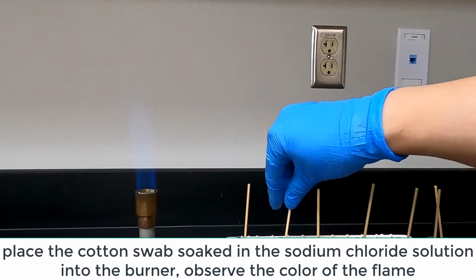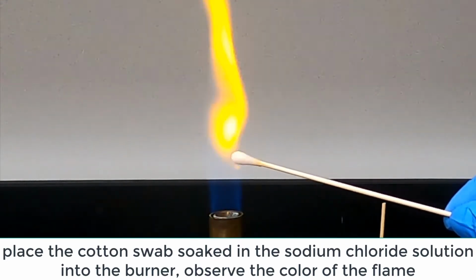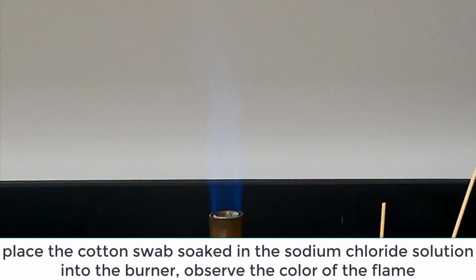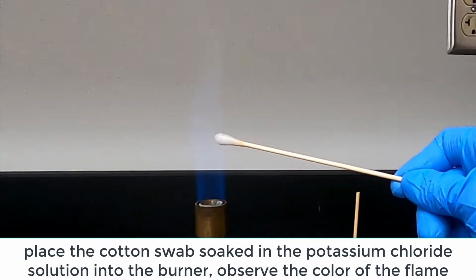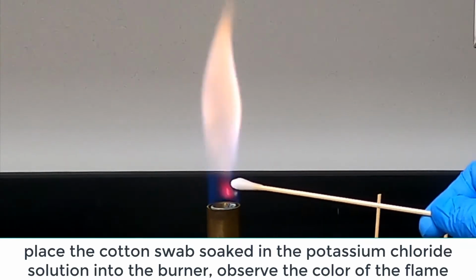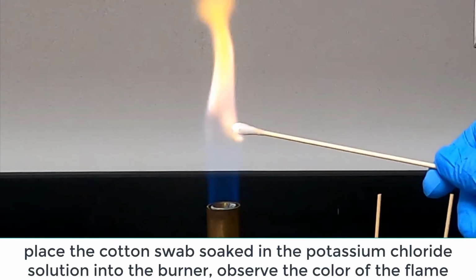Repeat the flame tests for sodium chloride, record your observations on the datasheet. Potassium chloride, record your observations on the datasheet.